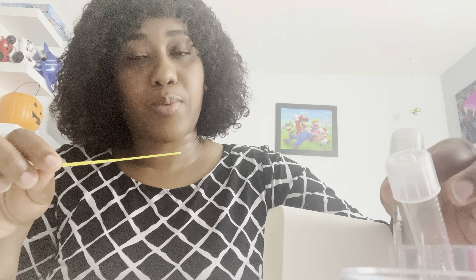The first technique I'm going to start with is transferring bacteria from one test tube to the other. First, I take my inoculating loop and put it in the micro incinerator for 10 seconds, then take it out and let it cool down for about a minute. Cooling down is important so you're not killing the bacteria — if you put in a hot inoculating loop, you might end up killing the bacteria.